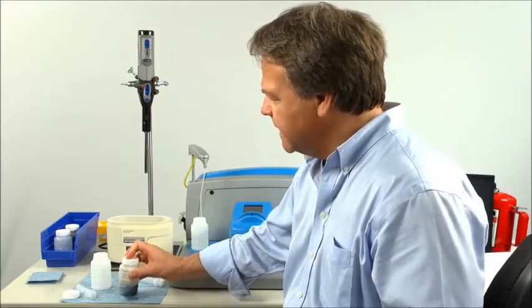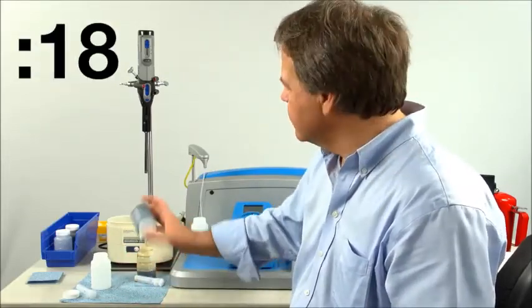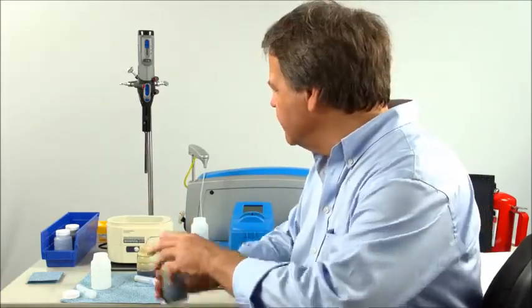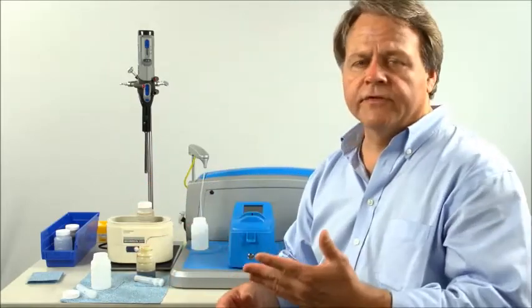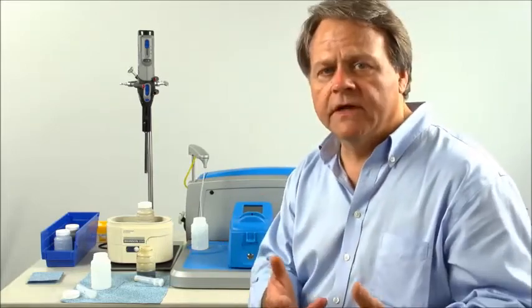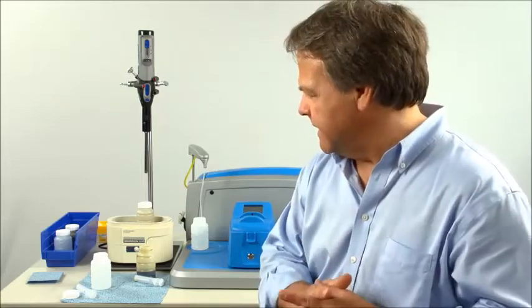Once that's done, again agitate the sample for 30 seconds. Once the 30 seconds has elapsed, place it in the ultrasound again for 30 seconds, and that will remove the air bubbles. So that is one methodology of preparing a diluted sample for analysis in the LNF.